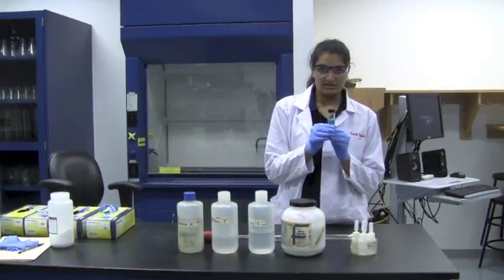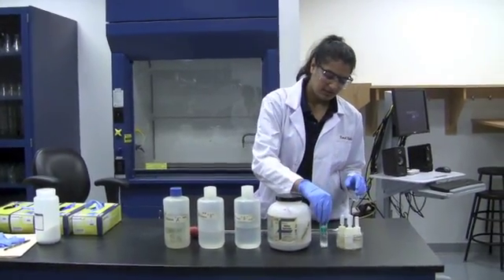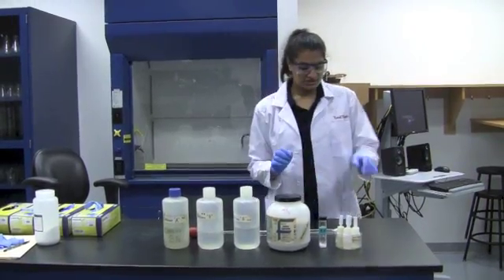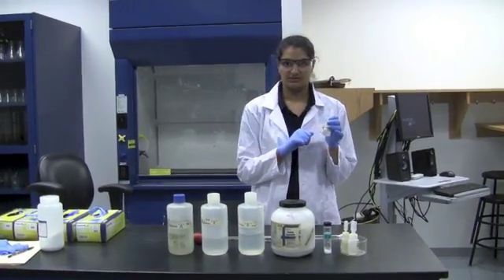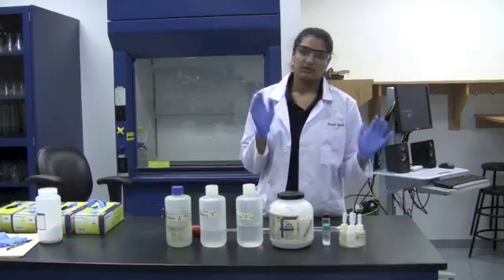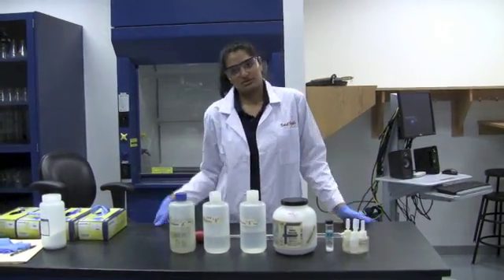You're going to be using KHP to titrate. And lastly, for your titration, you're going to have phenolphthalein, which is an indicator, which will tell you when your endpoint has been reached. Now, remember to wear rubber gloves, goggles, and clothes for safety.